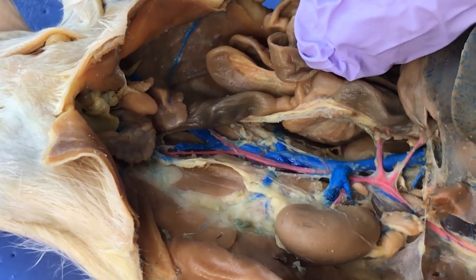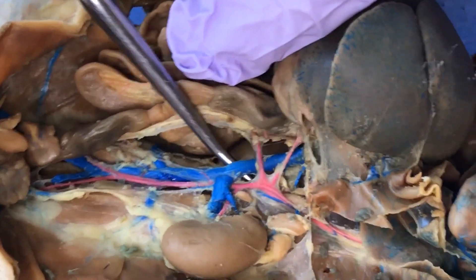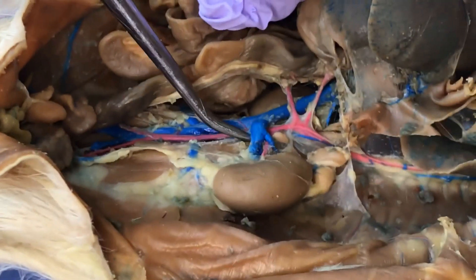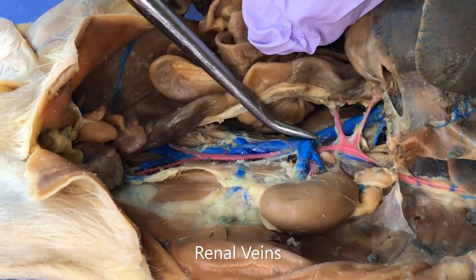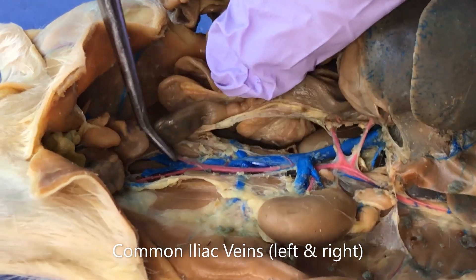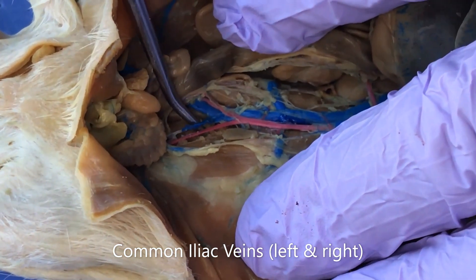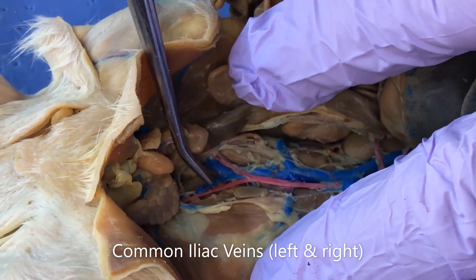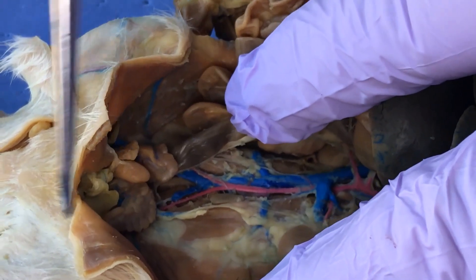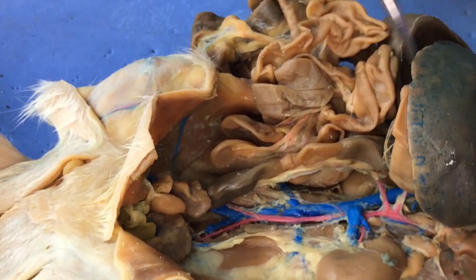Now let's look at some of the veins. This big blue vein right here in the middle is the inferior — or posterior, in rats — vena cava. This is a renal vein as it drains blood from the kidneys. The common iliac veins branch just like the aorta did, but they're bringing blood back the other way. This is the left common iliac and this is the right common iliac vein. The femoral vein would extend down into the legs.